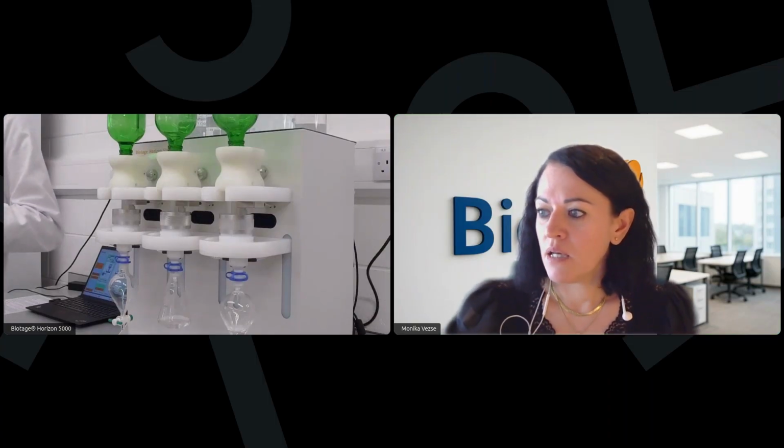Exactly. The compatibility of the system with high suspended solids. Yes. You mentioned that earlier in your introduction, but if you would like to, or if you could. Yeah, so as was explained, the system was really done with one purpose in mind, and that's to have one system process all of your samples without the need to essentially do any work prior to the SPE extraction.